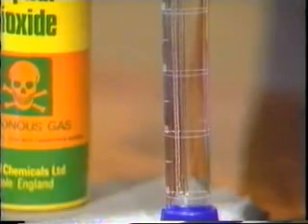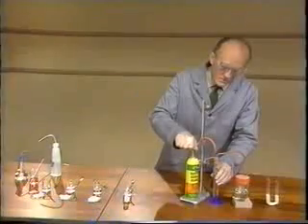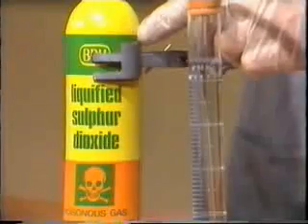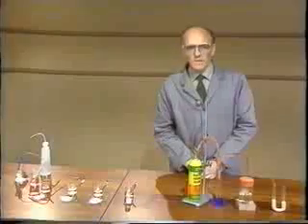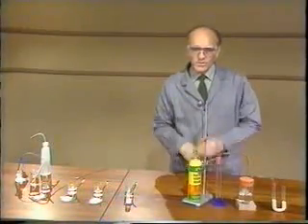I won't measure the temperature change, although there is some sign of a slight warming, despite the fact that the gas, as it leaves the cylinder, cools down because of the release in pressure. Dichlorine monoxide is even more unpleasant and toxic, so I won't be showing that one to you at all.